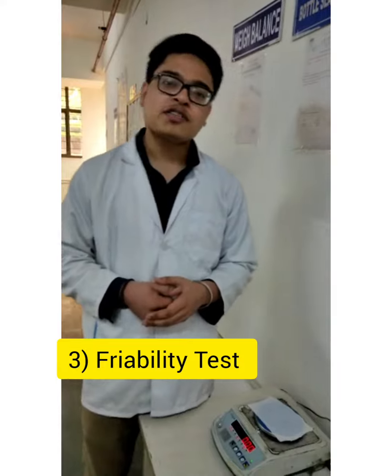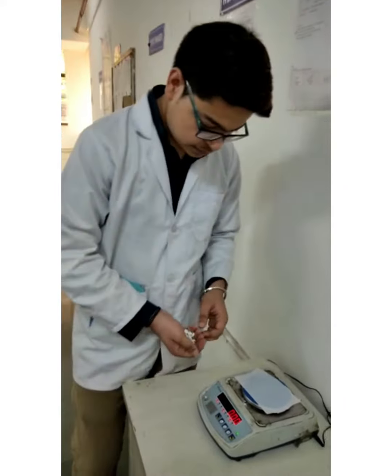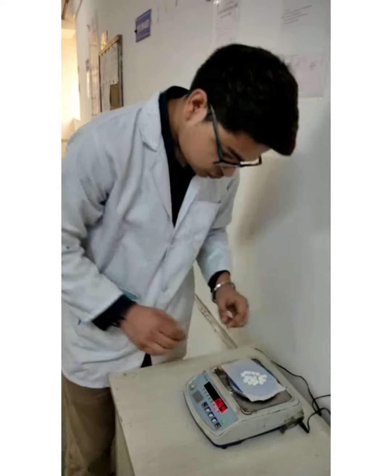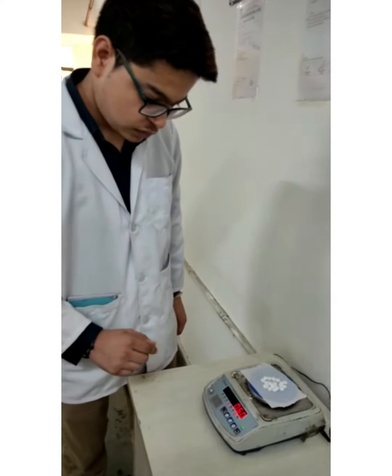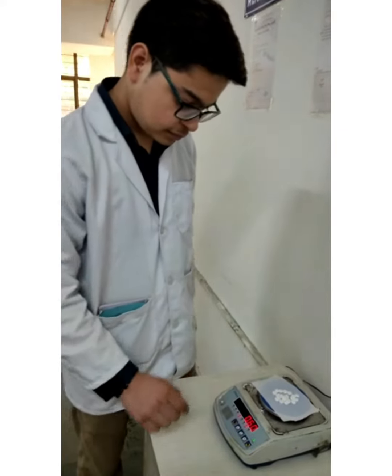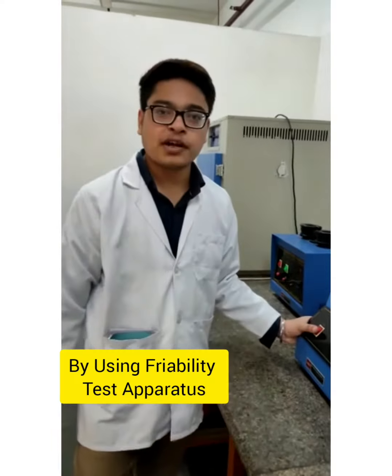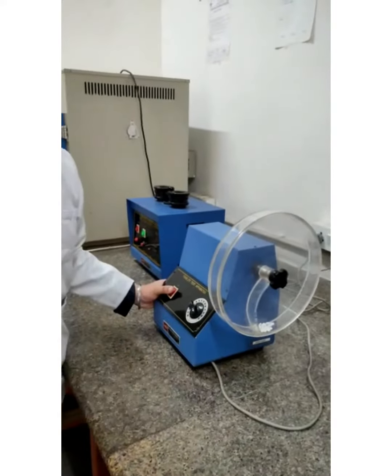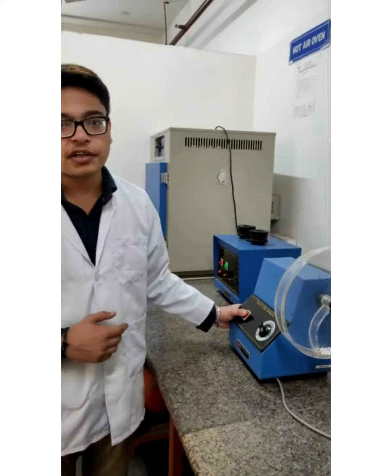Now we are going to perform the third test, that is the friability test. For this we are going to weigh 20 tablets. Now we note down the reading. This is our friability test apparatus. We have put our 20 tablets previously into it and now we are going to run it for 4 minutes at 25 rpm to check the friability.